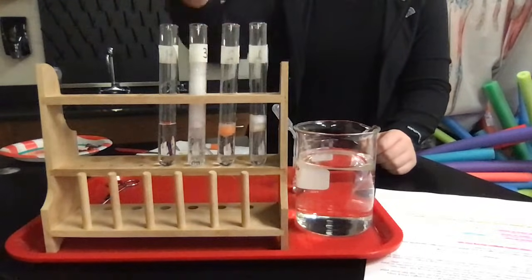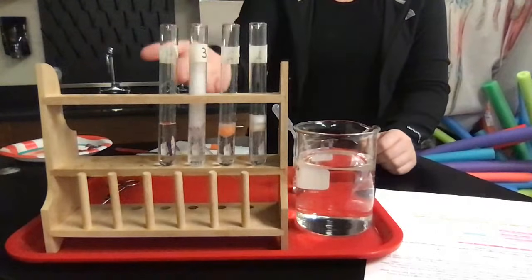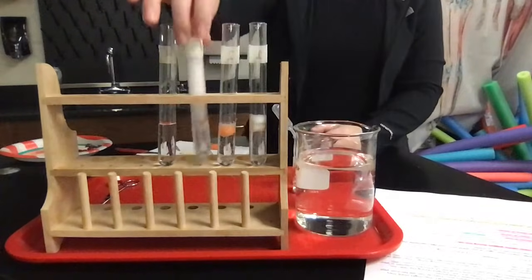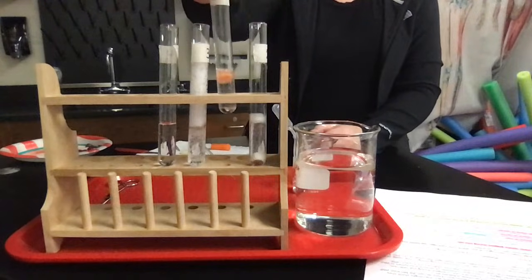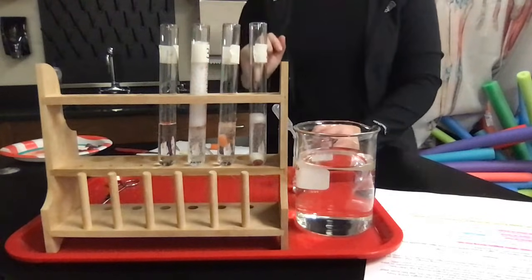I would say that in the bovine liver, you had the highest reactivity. So I would rate that at a 5. On my lab, I rate it from a scale of 0 being no activity to 5, most activity. So I'd probably rate this one at a 5. I would probably rate our potato at maybe like a 2 or a 3 and our carrot at like a 1, right? You can see the little bubble columns in each of these tubes.